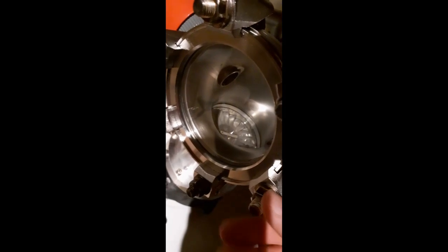If anything at all enters those rotor blades down there, those will be spinning around 80,000 RPM. If anything touches those, the entire pump will just disintegrate. And on this long hose here, it'll just fly around the room like a mace, and that's not a very nice prospect. The pump is bolted down, as you can see here. But yeah, that's pretty much the system.